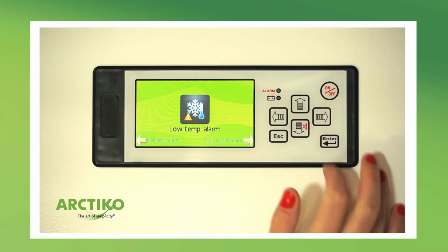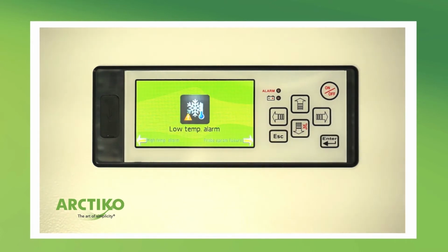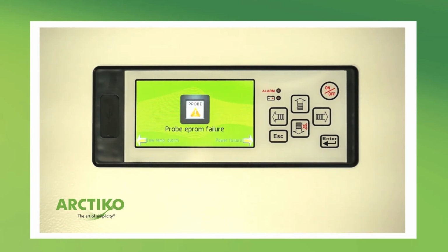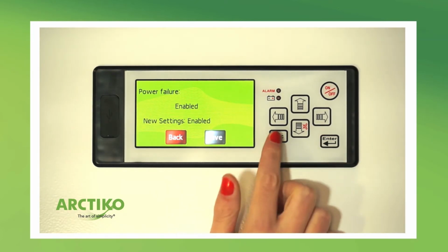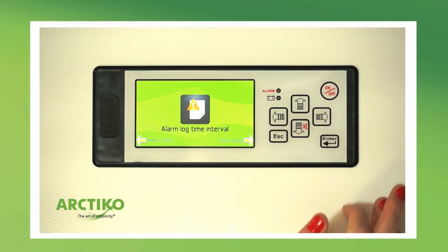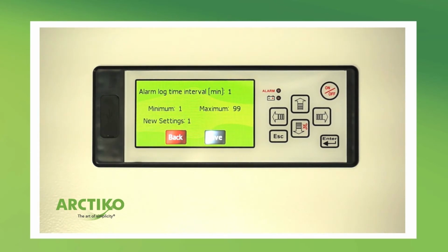In low temperature alarm, set the lowest temperature the device must be inside before the alarm starts. The probe EEPROM failure alarm indicates that the probe is not working. The power failure alarm indicates that there is no power to the unit. Alarm log time interval sets the time intervals for the controller to log data from the unit.